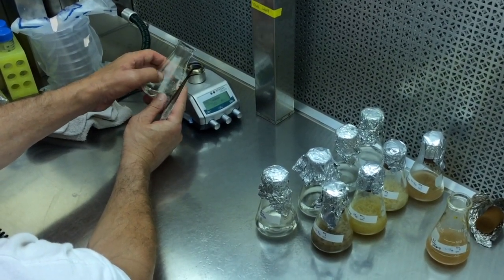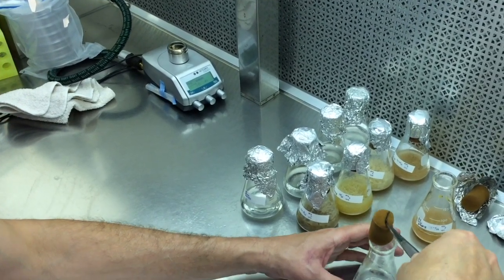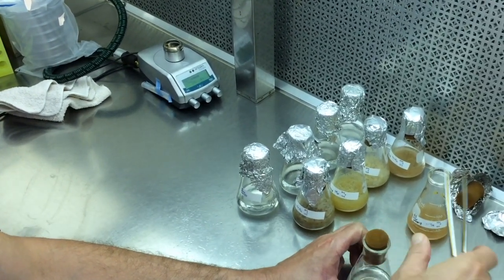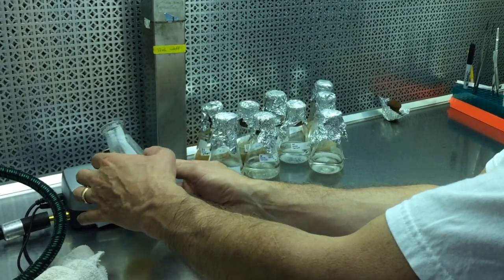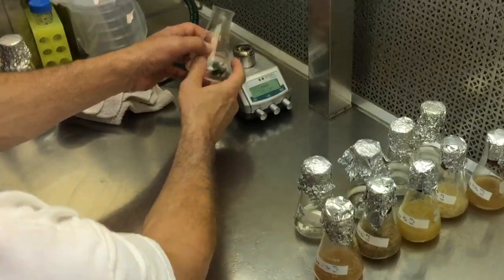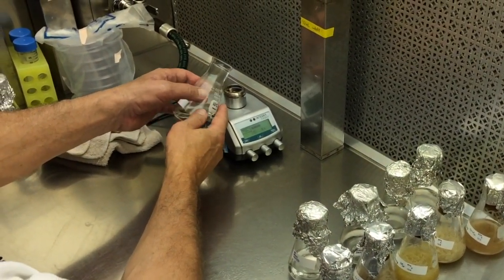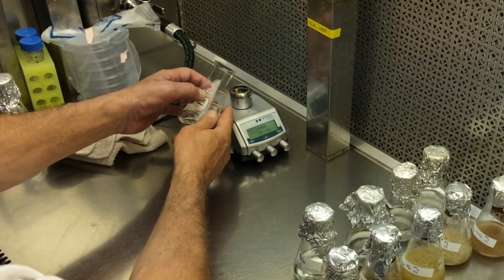This is called flashing. It causes gas expansion, so it decreases chances of contamination. Six seconds rolling it around, you can see the condensate go away as you go, and that gives you a good idea that you have at least sterilized the top of the unit.